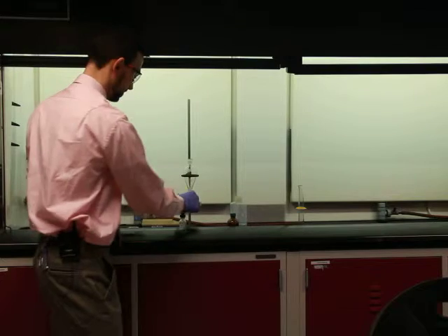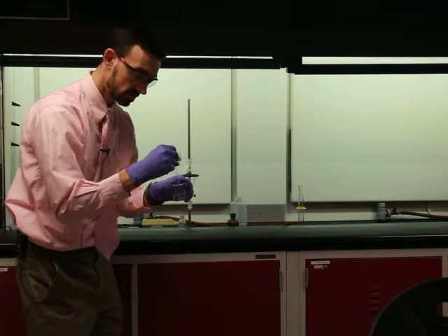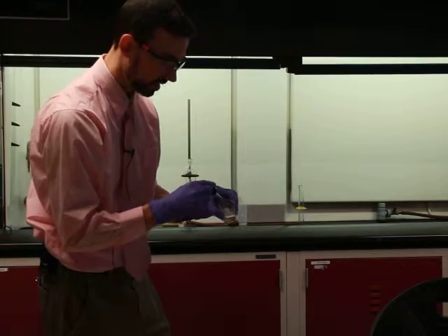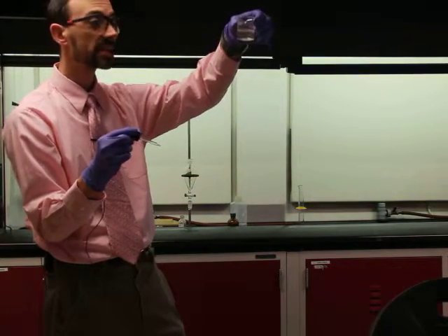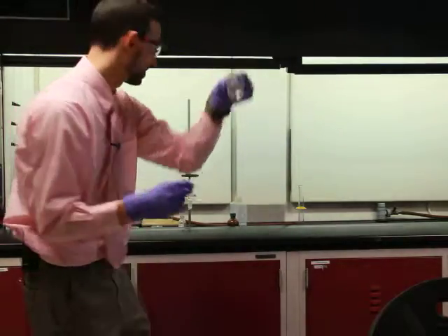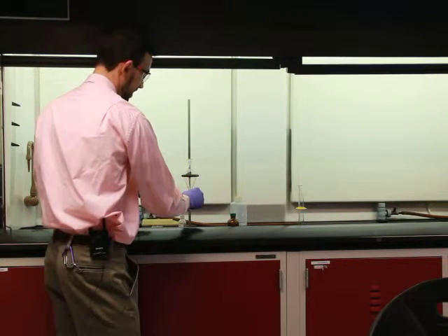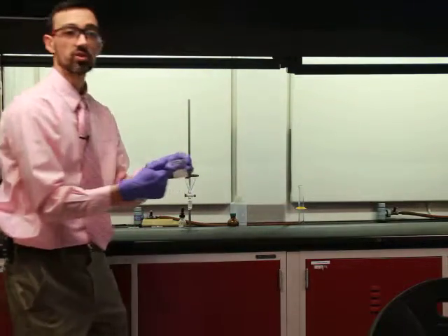Well, actually, where to go? It's strange, they're rising to the top. I could see stuff here, and as I swirl it around, it looks a little bit like a snow globe right now. I could see the flakes of the acid. That's often a good way to describe this. But this is how we would then recover our acid, and it would be a simple matter of filtering this.